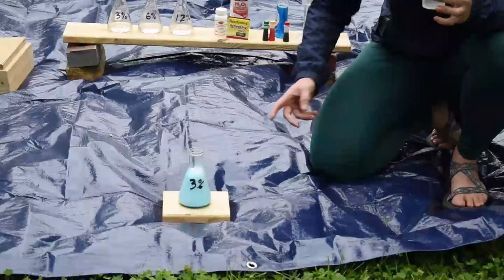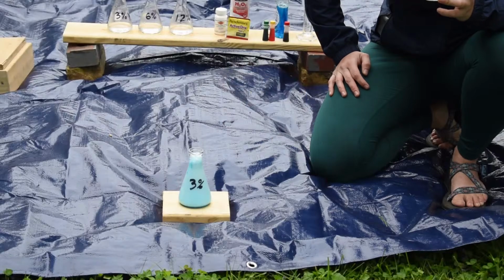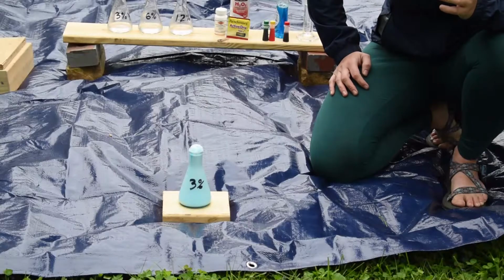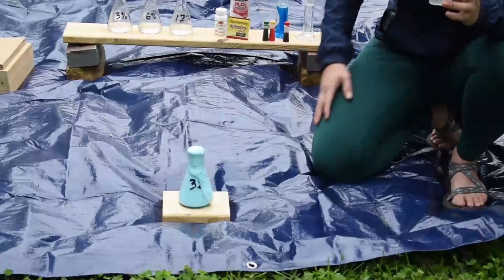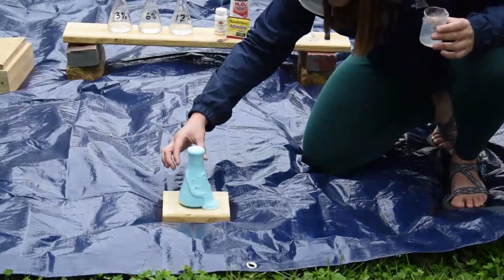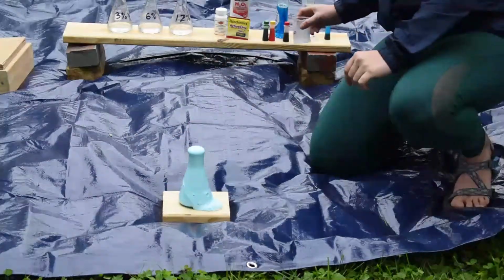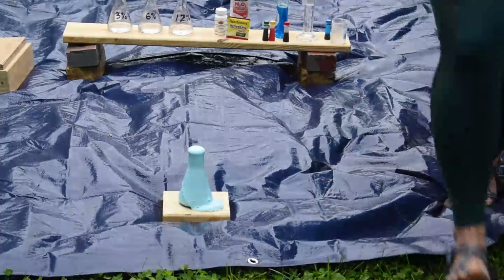It's almost to the top, and slowly, we should fast motion this. This one's anticlimactic for the cliffhanger that I left you guys on. But we got some foaming happening now. Good stuff. While I get our next one set up, I'm gonna let this just chill there.